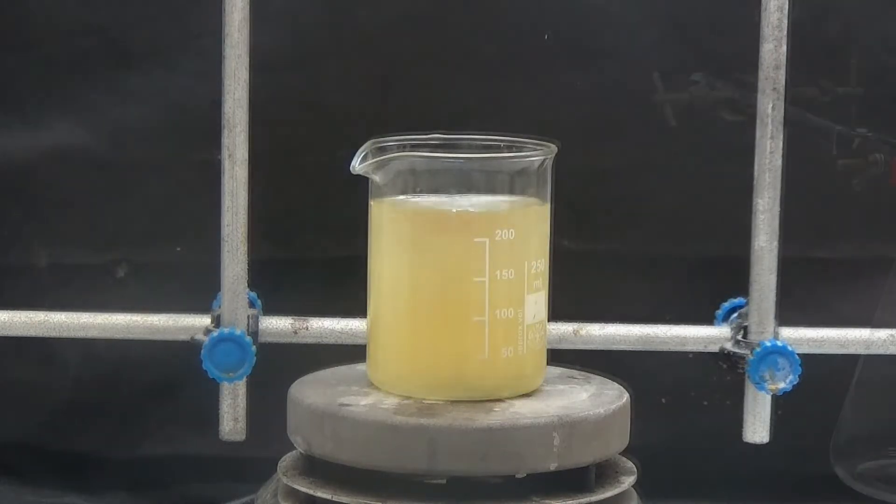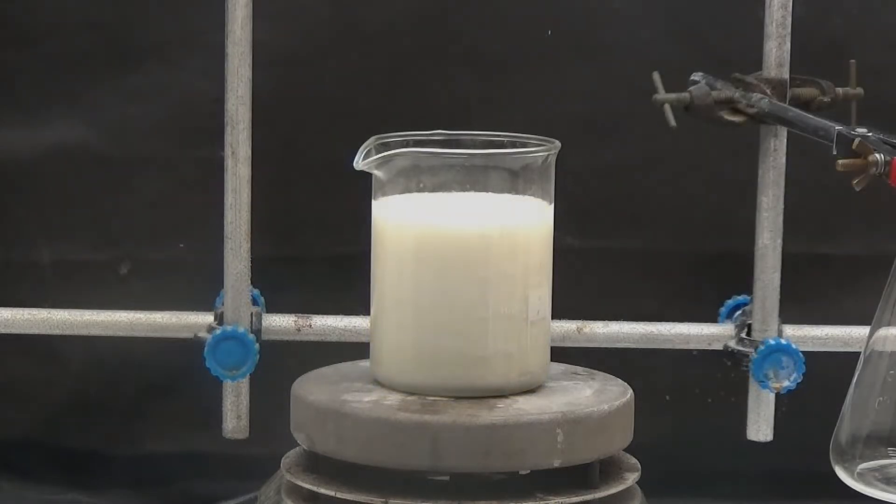After 30 minutes, an insoluble white solid forms. This is a bisulfite addition compound with the aldehyde.